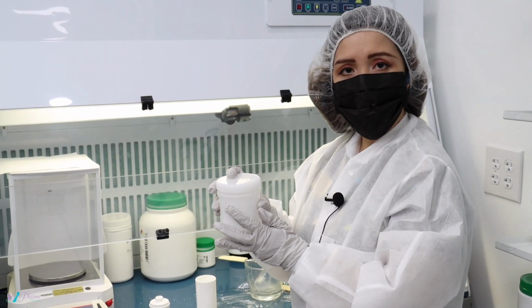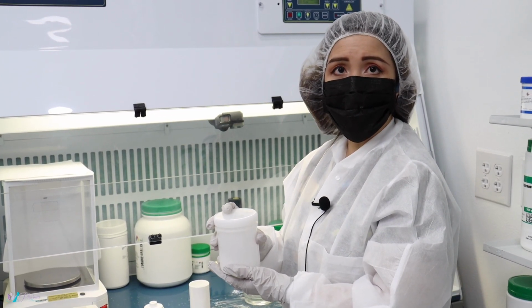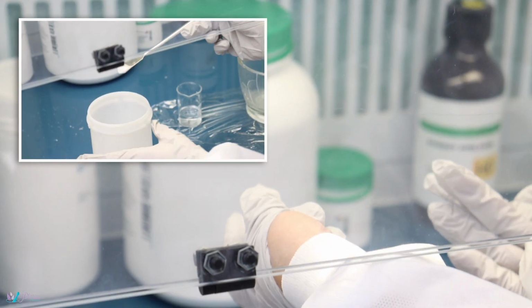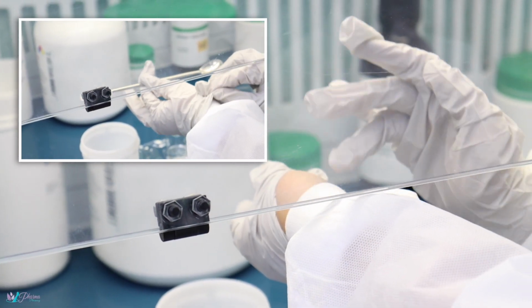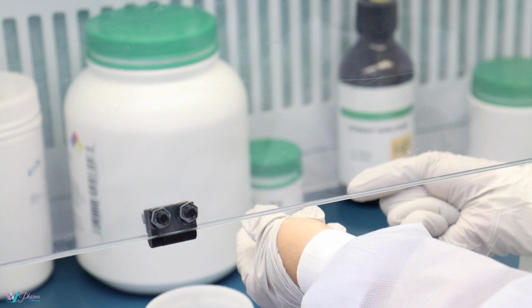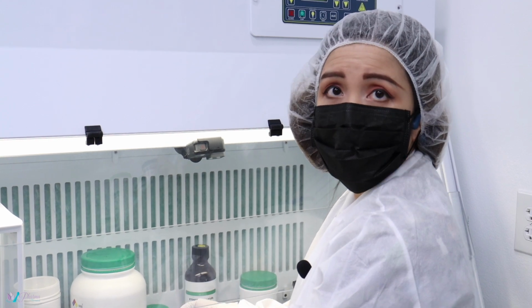The mixture is homogeneously mixed, and now we're going to conduct a skin test to ensure that the final product is smooth and cosmetically appealing and that there's no grittiness. We want to ensure that when the patient applies it, they don't have a gritty sensation and it's a smooth application. It doesn't matter if it's a cosmetic product or a topical pain product, we apply the same high quality standard across the board.